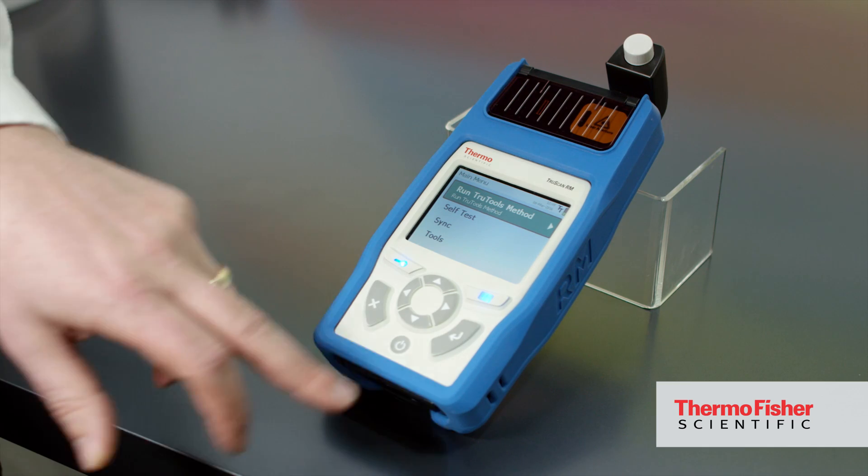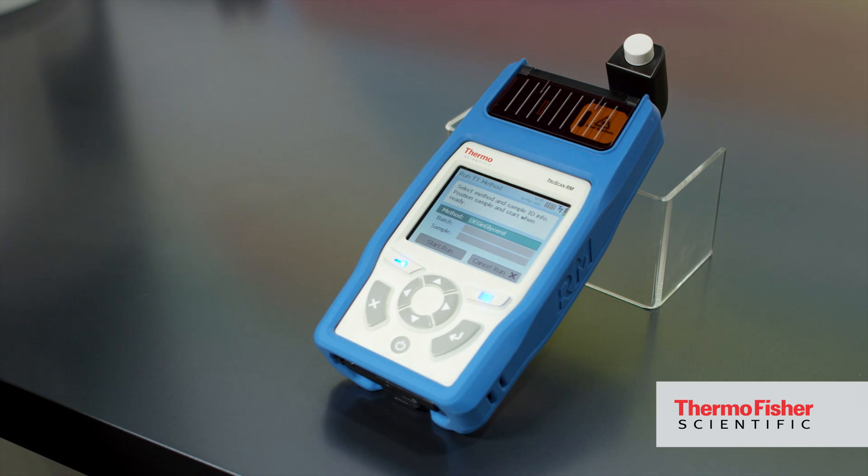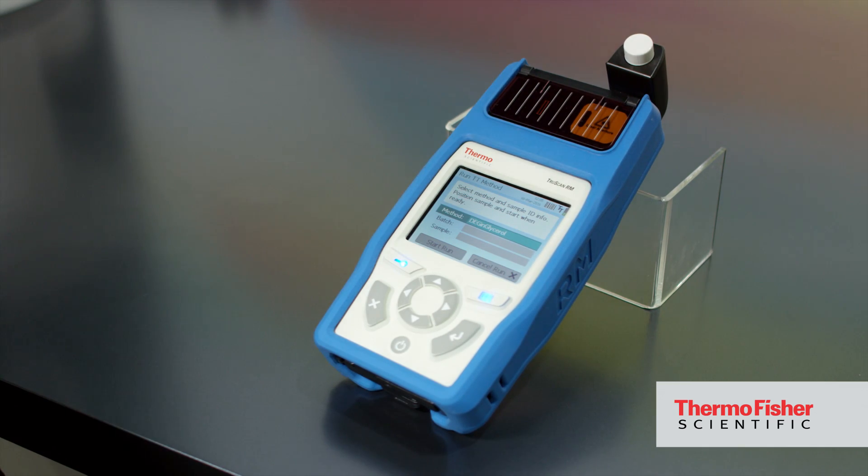In the field, in the hands of an engineer or a sampler, they can immediately get real-time results about whatever they have in front of them — whatever sample, whatever drug products — without the need of having a trained scientist with them.